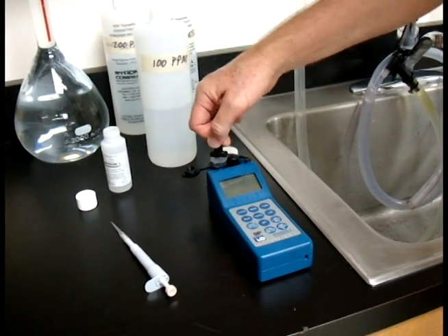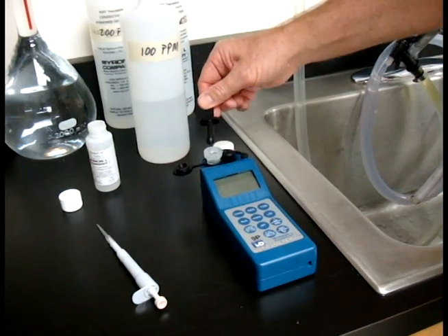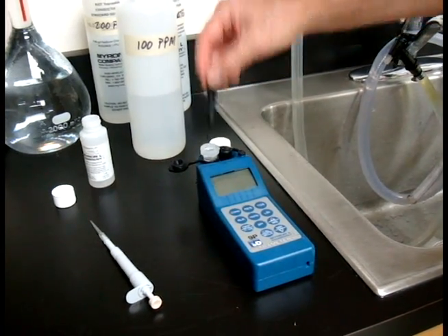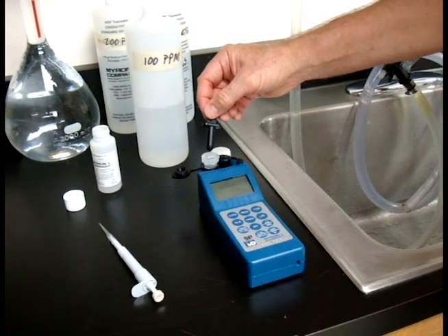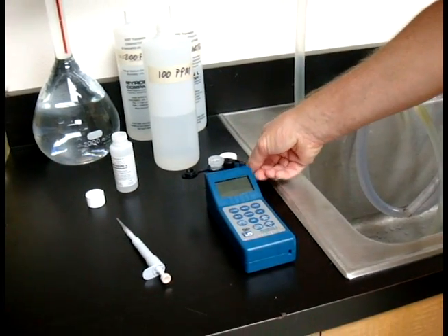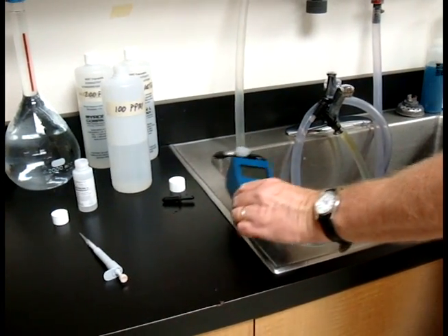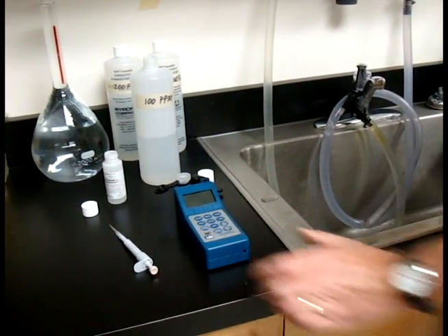Twist it just a little bit. And then if there's any dew here, you want to make sure you tap that out. Make sure you don't fling this out because you'll take some solution with you, what you need. So we'll put that to the side. And then I like to get rid of my excess here in the bottom well. And then we're ready to get started.